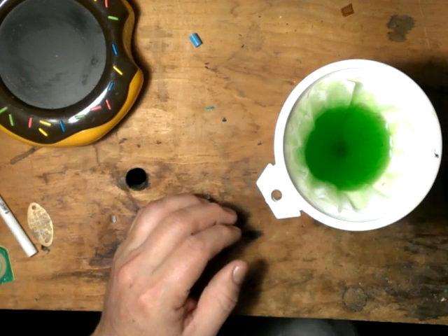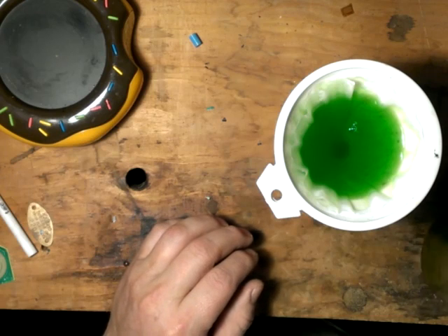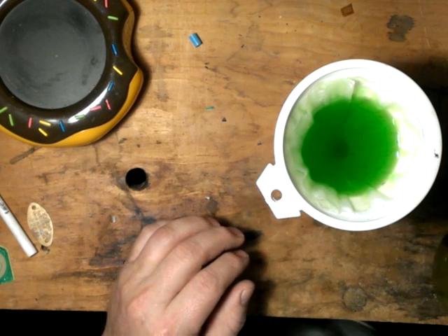There's still some fingers on there. Not all come off yet. It should be very close.